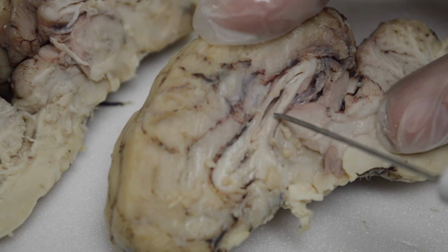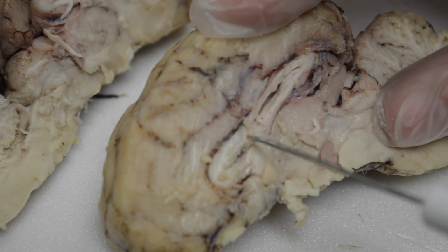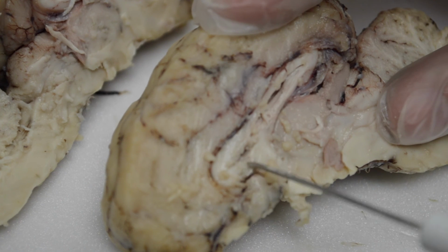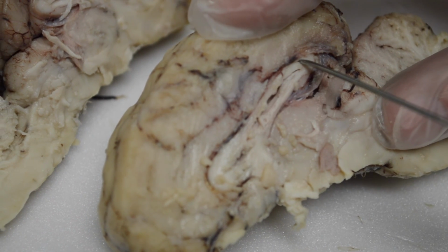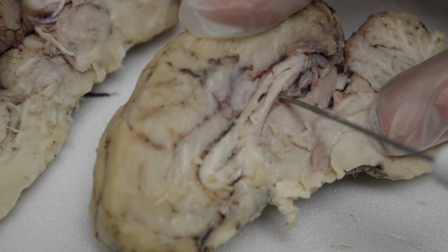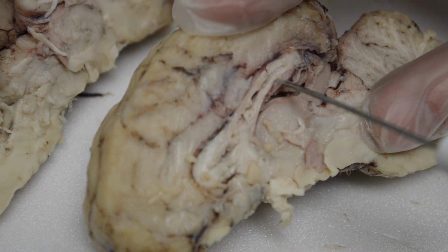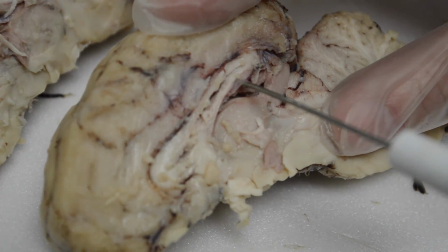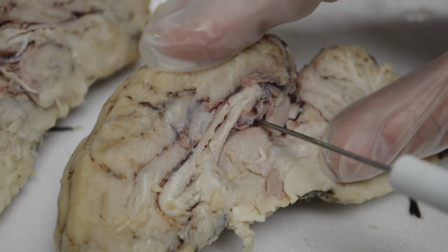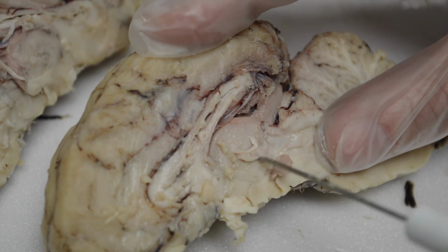Underneath is another structure called the fornix. So this under the lateral ventricle is the fornix. On top, making the little hook there and going around, is the corpus callosum. Now, underneath the fornix, this area here is where, and look at that, what do we have here? More capillaries and ependymal cells. This is where the third ventricle lies. And it's on top of this very large round structure here.